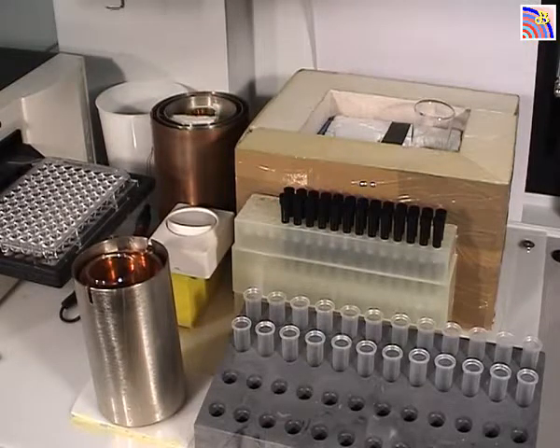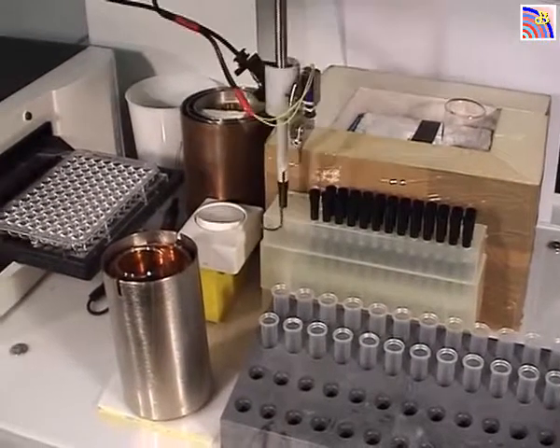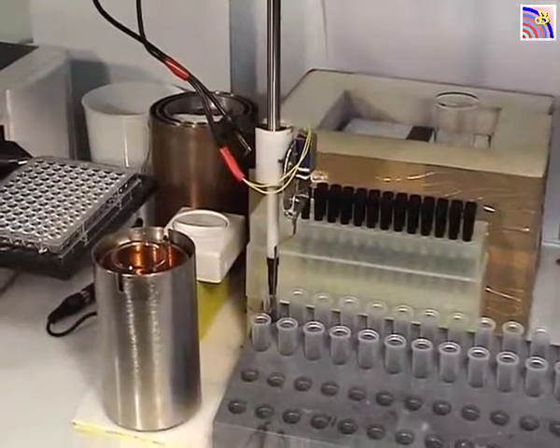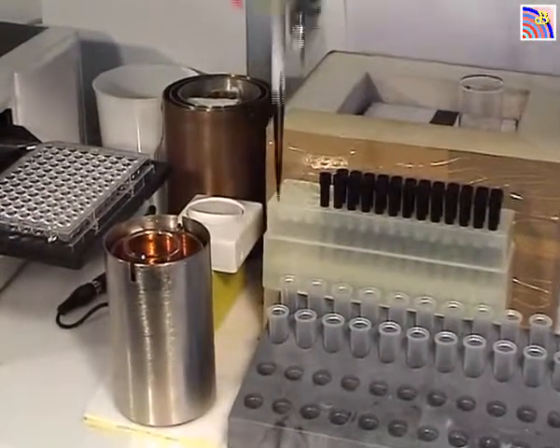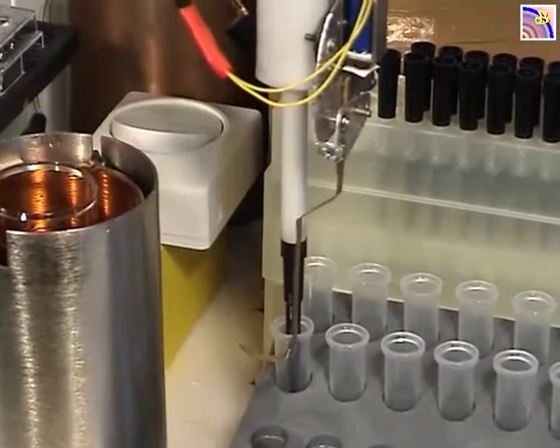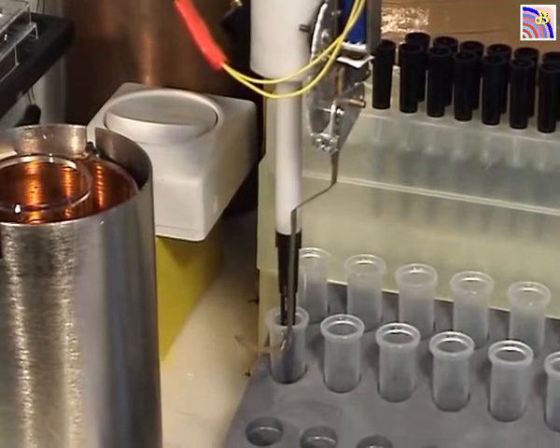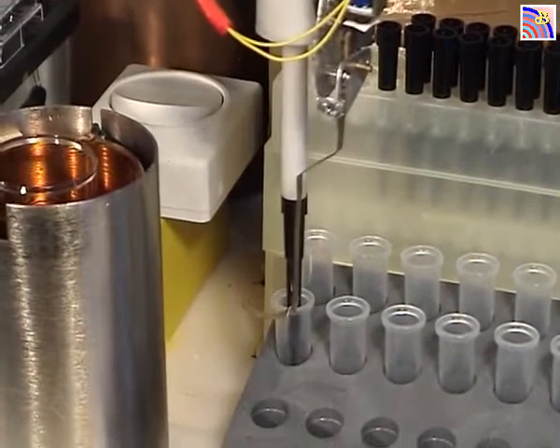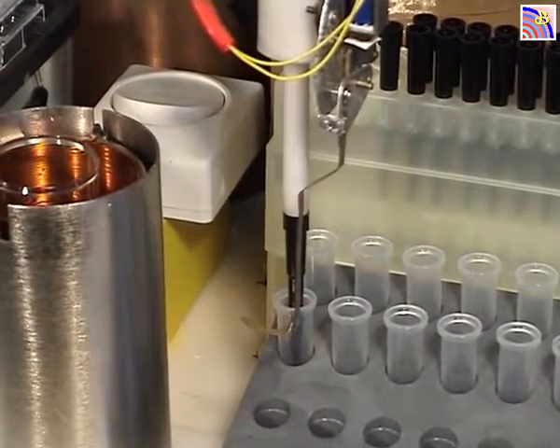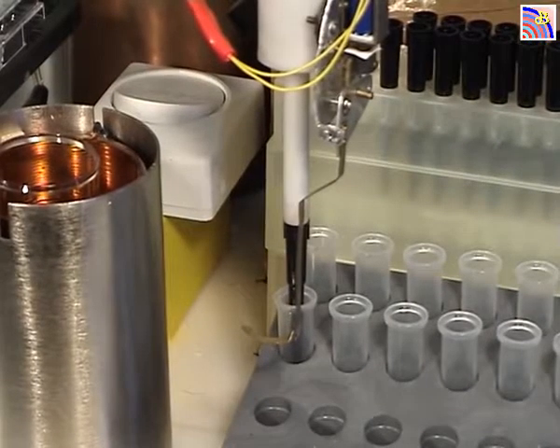Now the machine will mix the water — 200 microliters — with 400 microliters of plasma. So there will be a one-third dilution of the plasma. It will mix it thoroughly. That's the first tube that is well mixed.